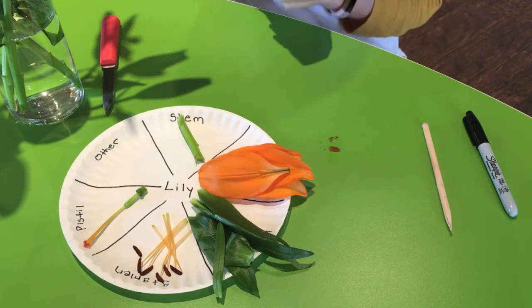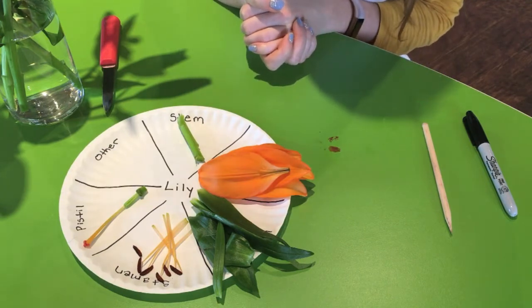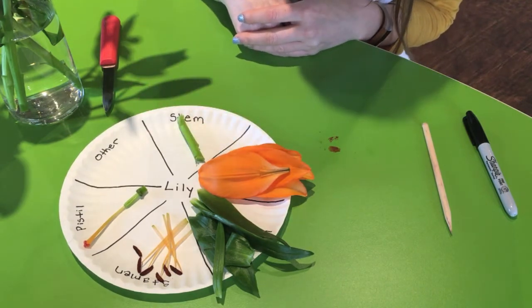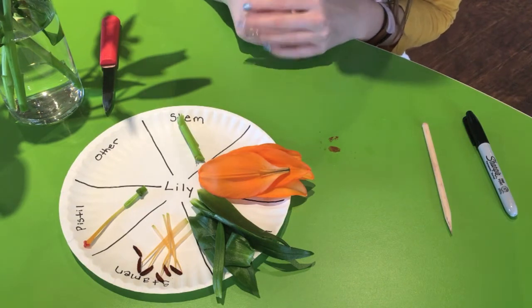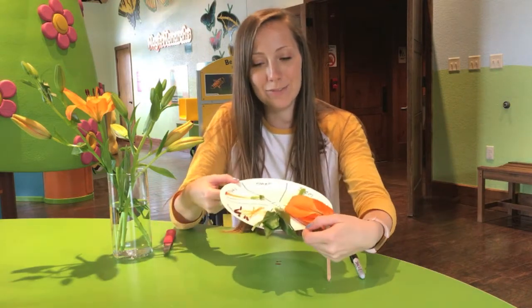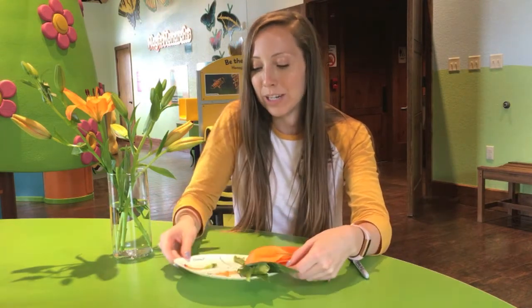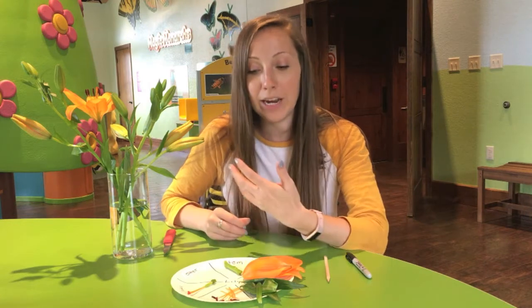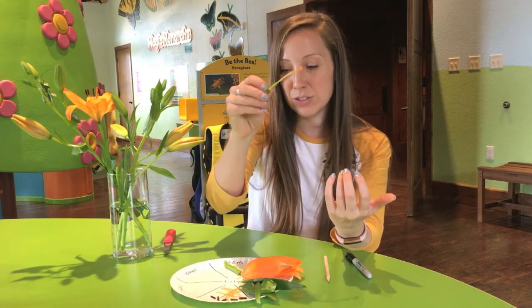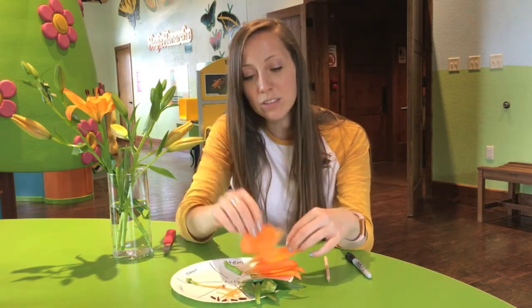And then if you happen to be dissecting and you find some other parts of your flower, because maybe you don't use a lily, that's where you can stick them in the other section, and then you can do some research to find out what are some more parts of a flower. So now that you know all the different parts of this flower, you can go ahead and dissect your own flower. It could be a lot of fun too to try to dissect different types of flowers and to compare and contrast the different stamens that you might see, the different pistils you might see, the different petals, the different leaves. So have fun with this, and I hope you guys enjoy learning more about the different parts of a flower.